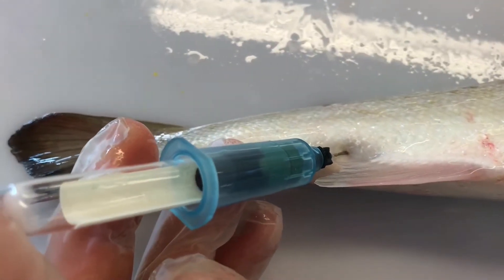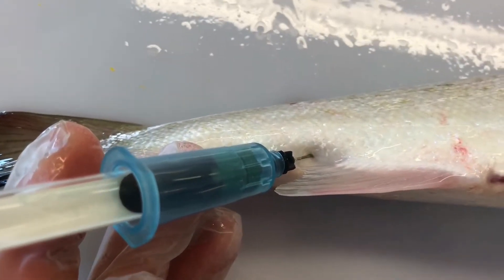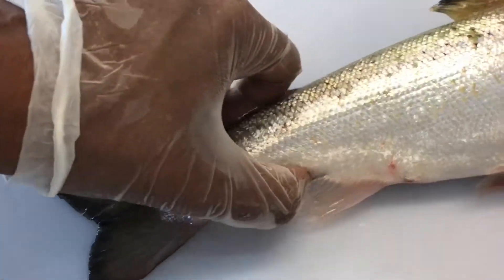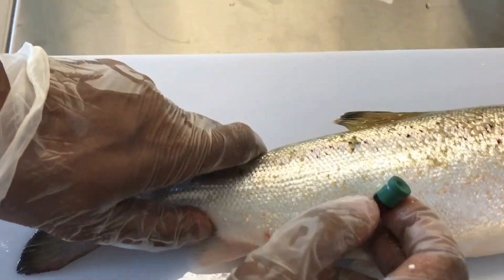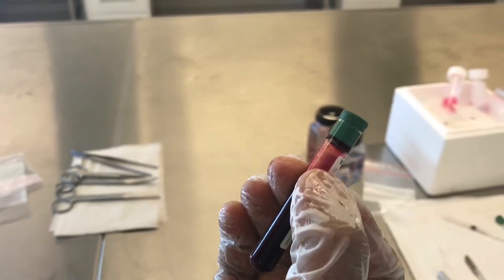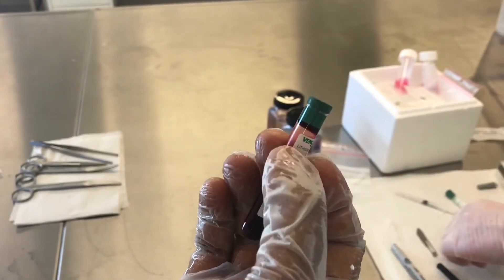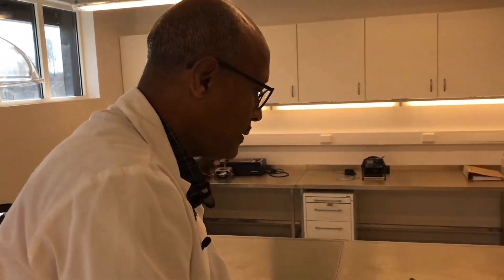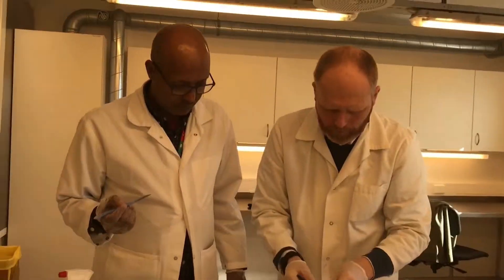As you see, the blood is coming. This blood sample can be transferred to another tube with anticoagulant, or if this tube already has anticoagulant that's fine, and this can be kept in the refrigerator.